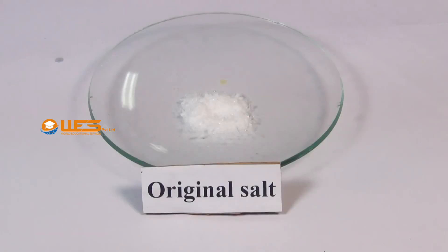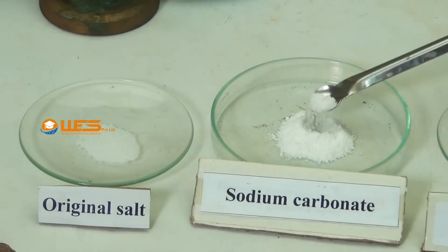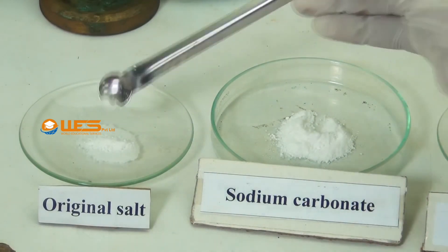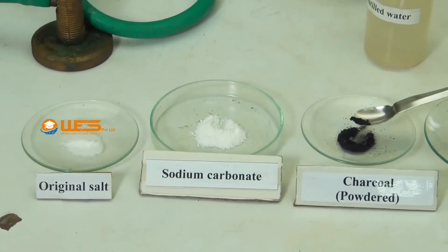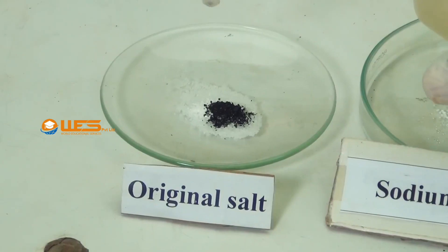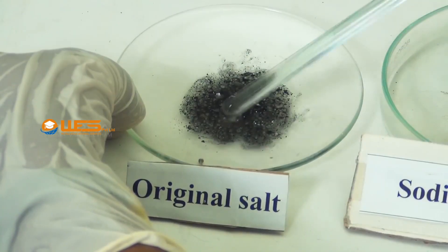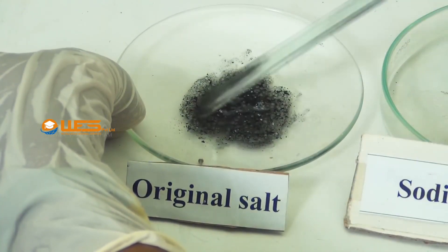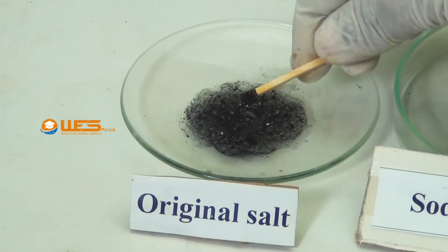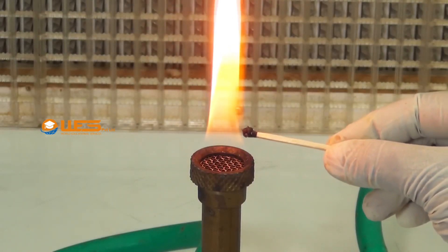Procedure: Take a small amount of the salt in the watch glass. Add a small amount of solid sodium carbonate using a spatula. Then add a little powdered charcoal using another spatula. Add a few drops of distilled water to the mixture. Mix the contents of the watch glass with a glass rod to get a paste. Take some of this paste on one end of a wooden splinter and heat in the reducing flame of the Bunsen burner.